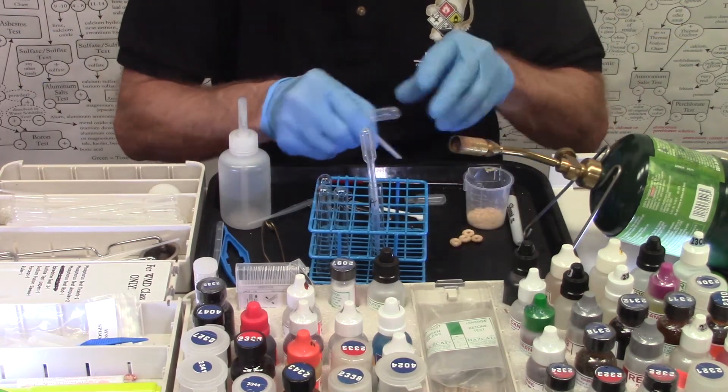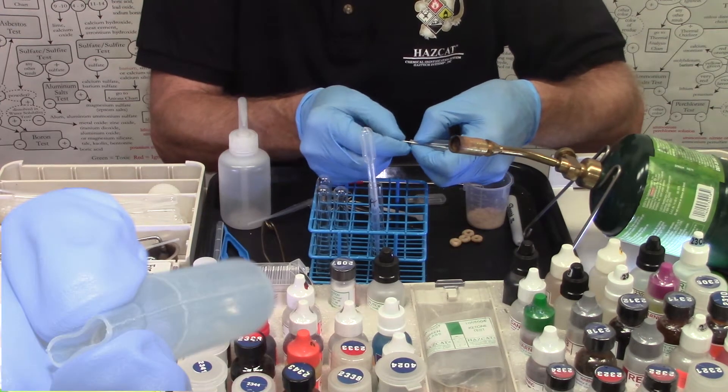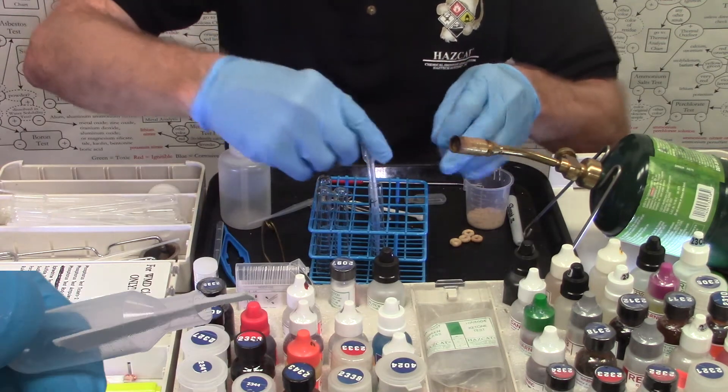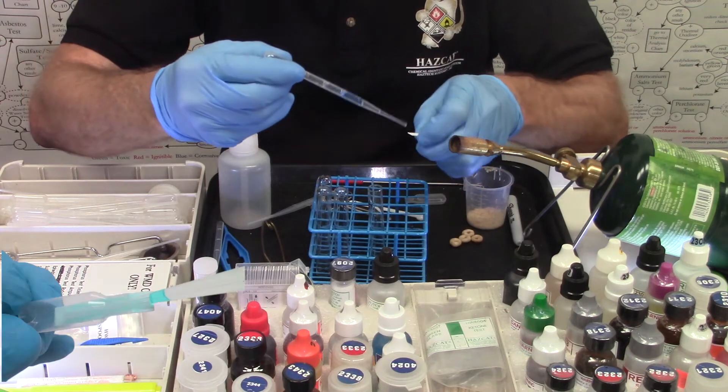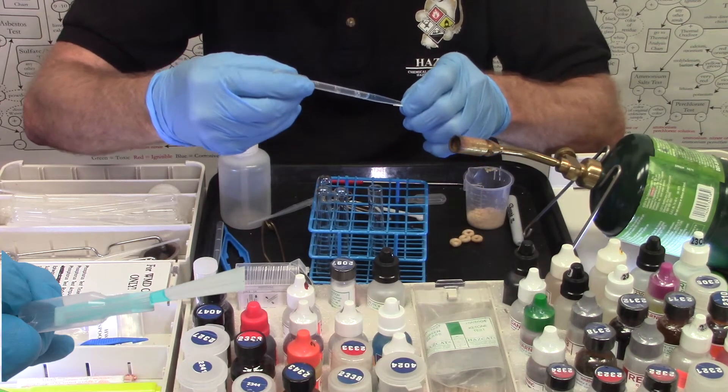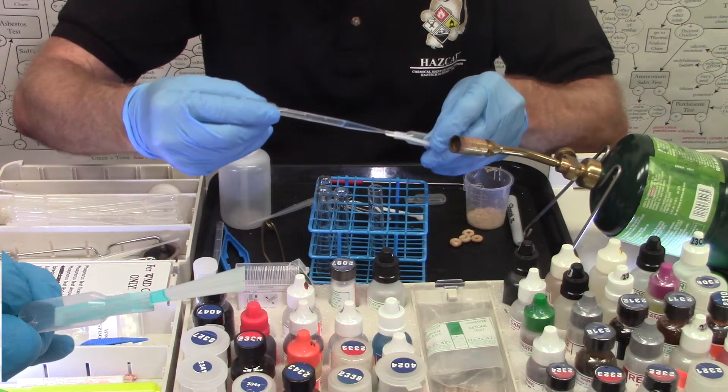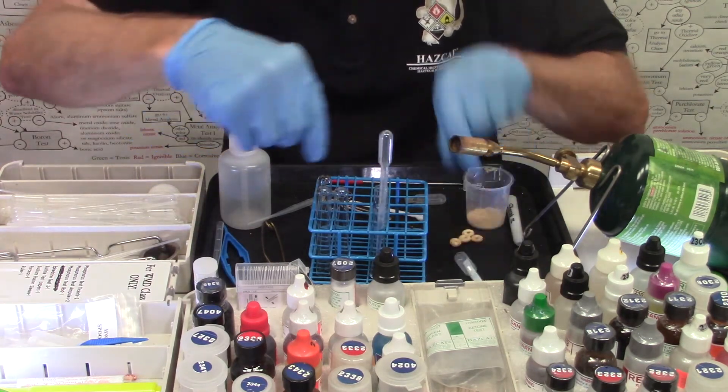Taking this reagent paper strip, squeezing the pipette just a little and leaving it so it sticks out about a quarter inch. I'm going to soak that with this blue solution I made from end to end by shoving the pipette up inside the bulb and dispensing about five drops onto the paper. Set the bulb aside.